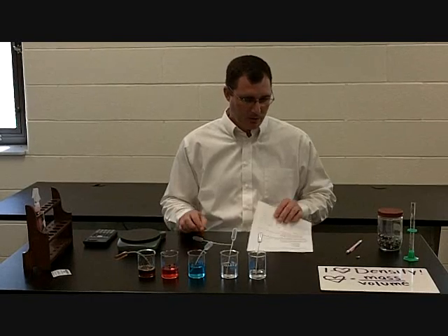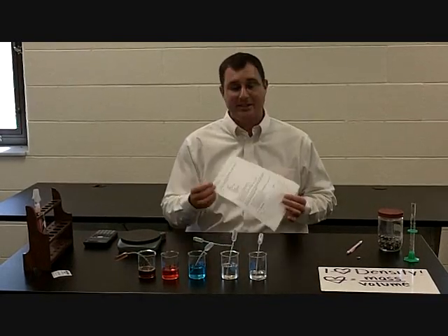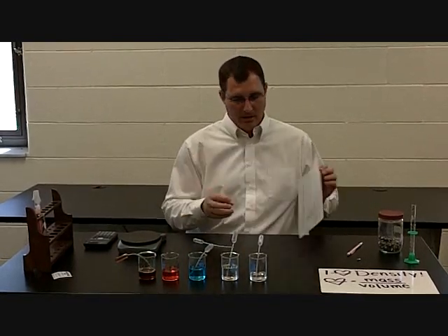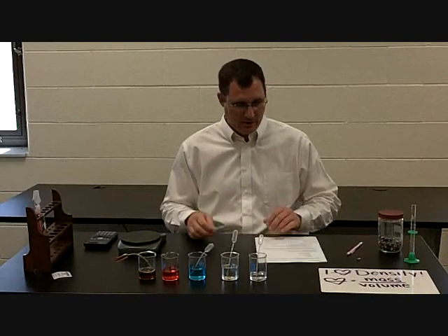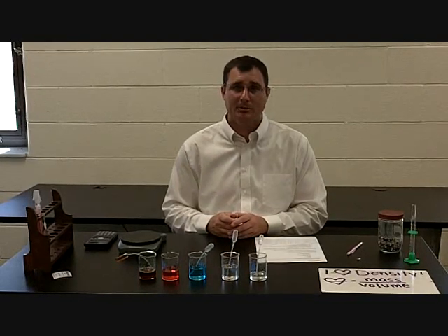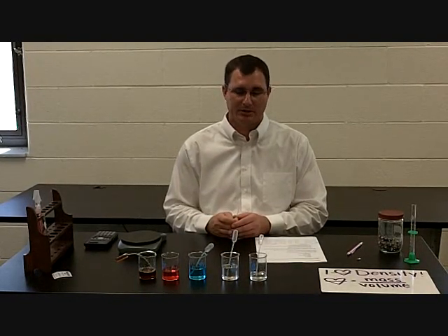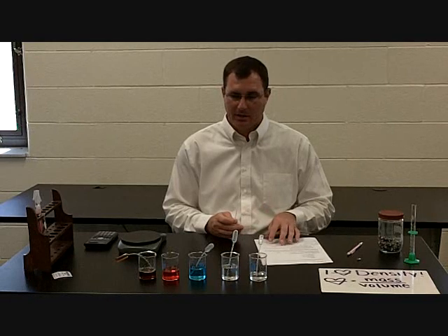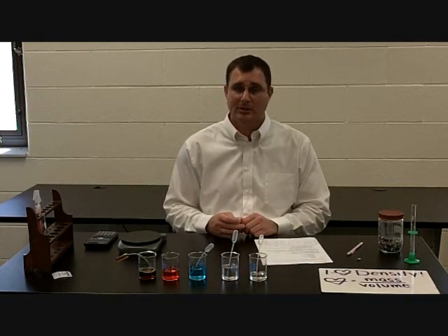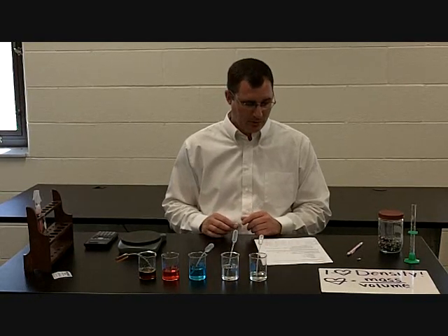Hi, guys, and we're going to go over the densities of five liquids lab. It's another lab that just helps us talk about densities and gain a better understanding, but it's a really fun lab to do. So let me go through this with you.